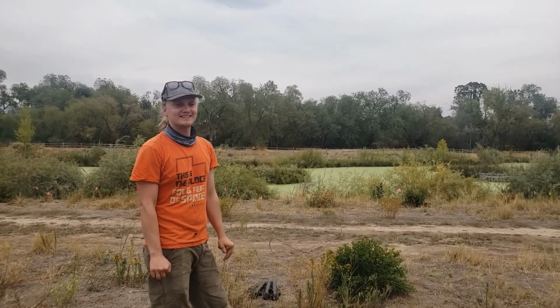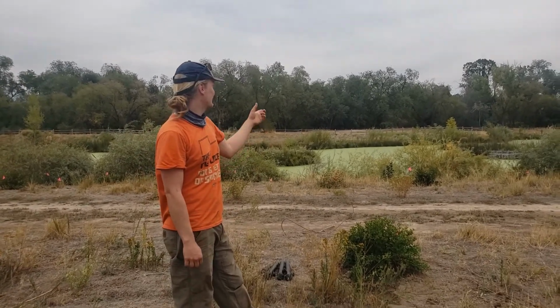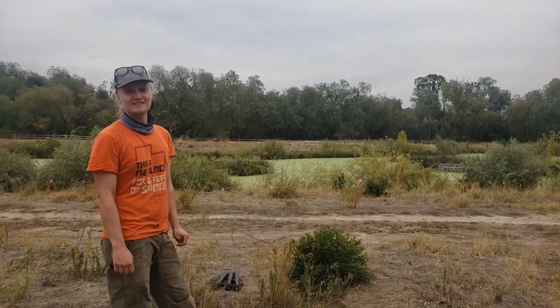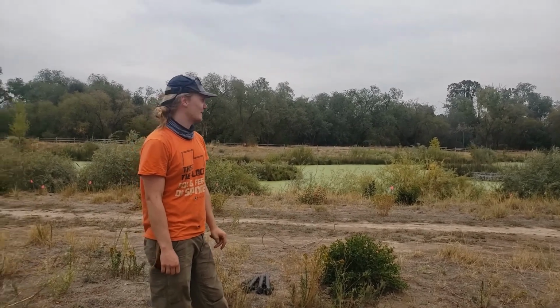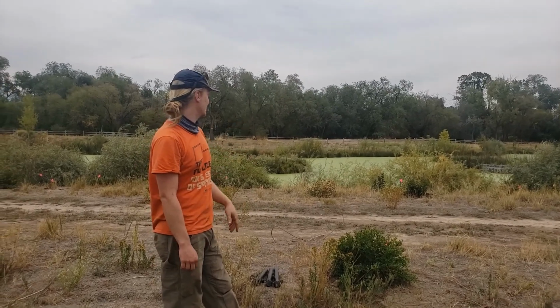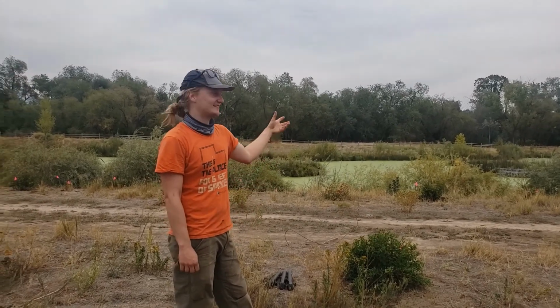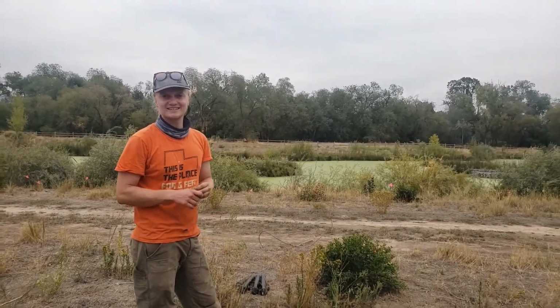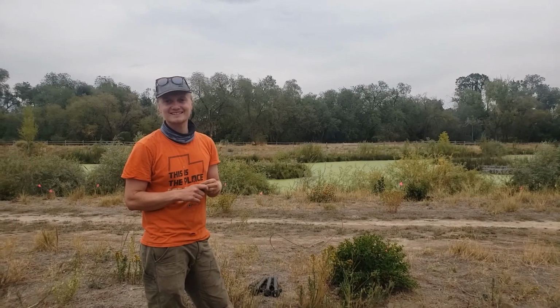And what's your hypothesis? I'm assuming there's going to be a lot of nitrogen and phosphorus in here, because there's so much duckweed floating on the surface. But so what's the connection there for you? What connection are you making? The nitrogen and phosphorus, the plants enjoy that, and there's an excess of duckweed here. Cool. Awesome. Well, we'll see what we come up with, and I'll share my data with you.